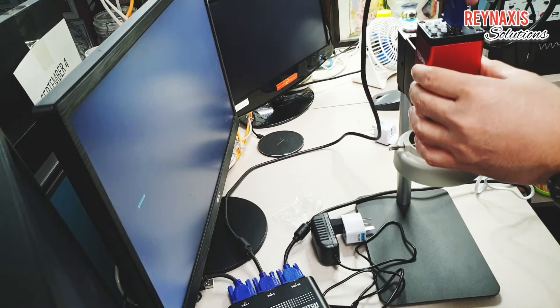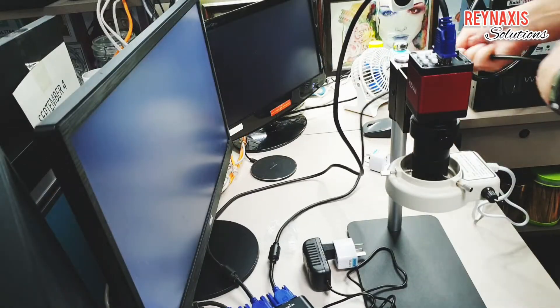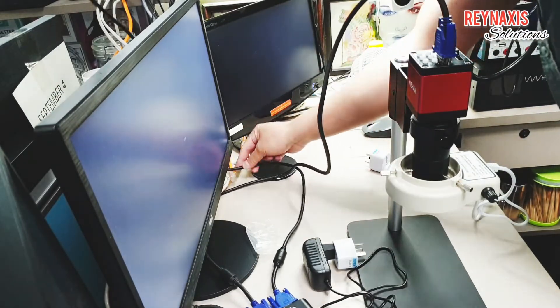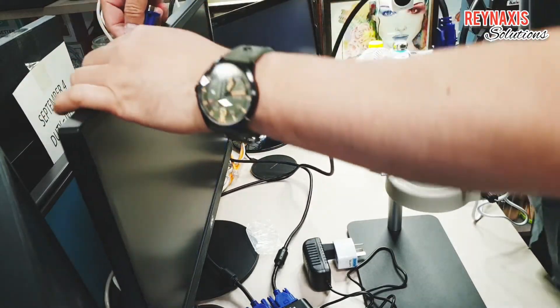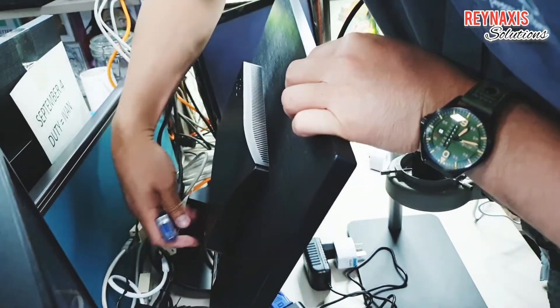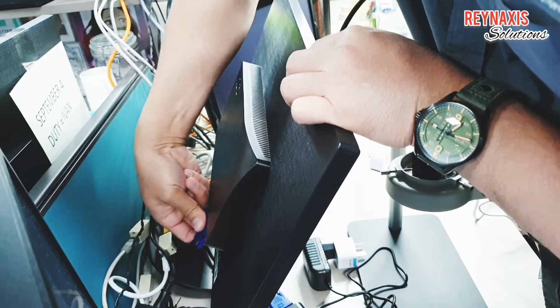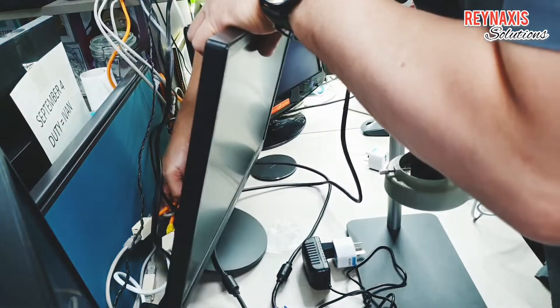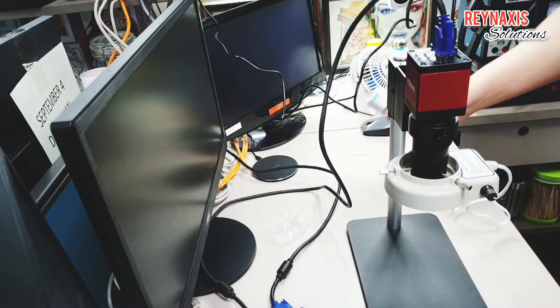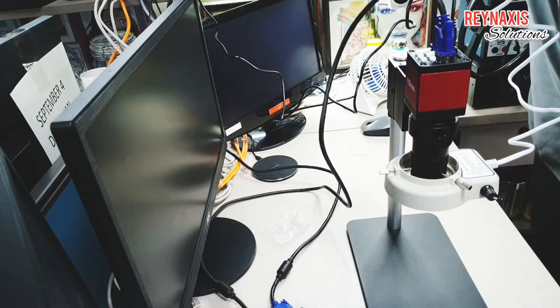The VGA port on this camera is located at the top, so your VGA cable will be protruding from the top and you won't be able to tie it to the bar because you're sliding the camera holder onto it — so it's just going to be like that unless I find a way to make it tidy.